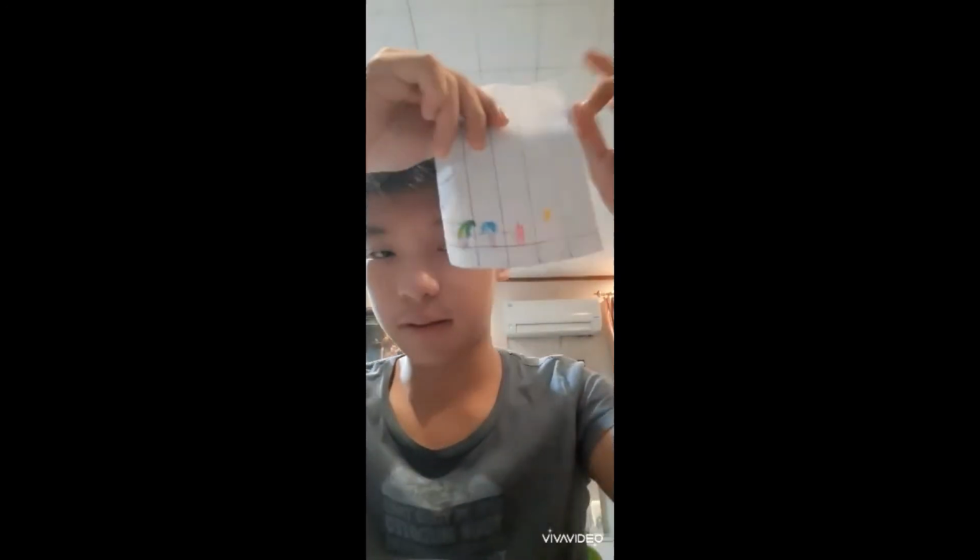And now we wait. So it has been about 30 minutes, and this is what it looks like now. This is the mixed color, and you can see it goes up. The color goes up. This process takes a very long time until you actually see the full results, but this is what is to be expected, and that's it.